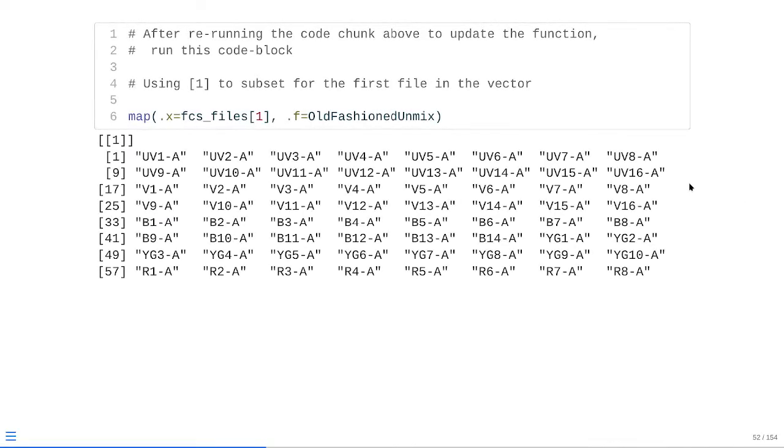And in our particular case, we already have the same column selected. We didn't need to make any changes, so it was all set to go. But if we had one of those edge cases, you could see it's still retaining the columns that we're actually interested in.